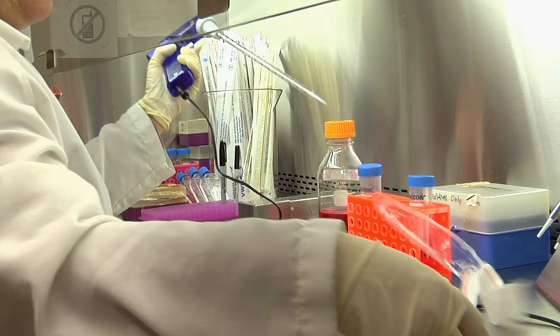Note that placing the pipette in the pipette holder can also be done last. You should always be aware of where the tip of the pipette is. If it touches anything, the pipette should be changed to reduce the risk of contamination.